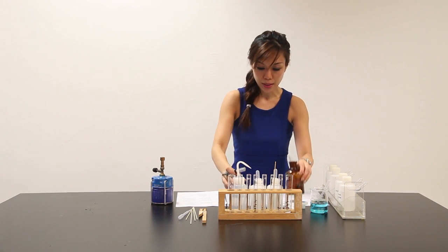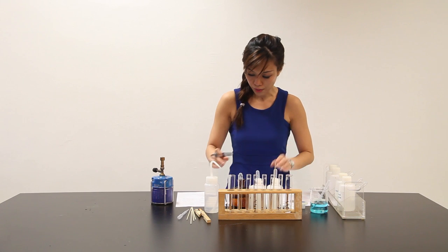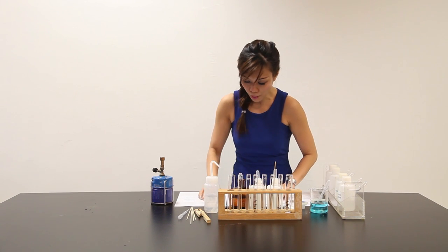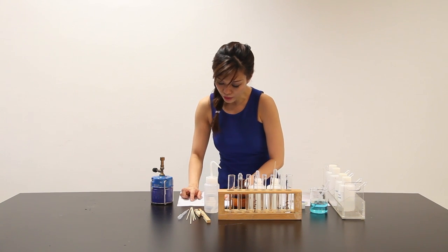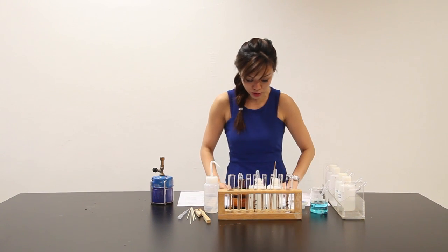So another 2 cm³ of HCl. So this is my part D. Let me put here barium chloride and HCl. Now, according to my QA notes over here, when barium chloride is added, you're actually testing on sulfate. Let's move on.